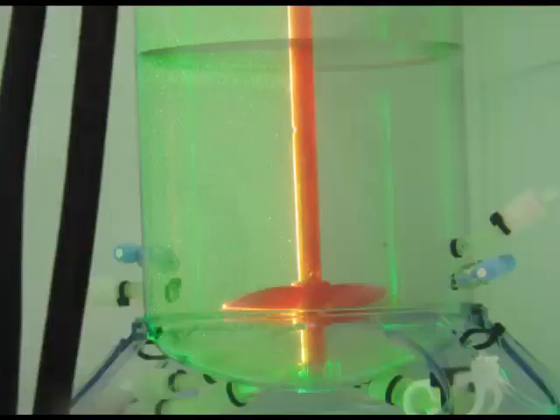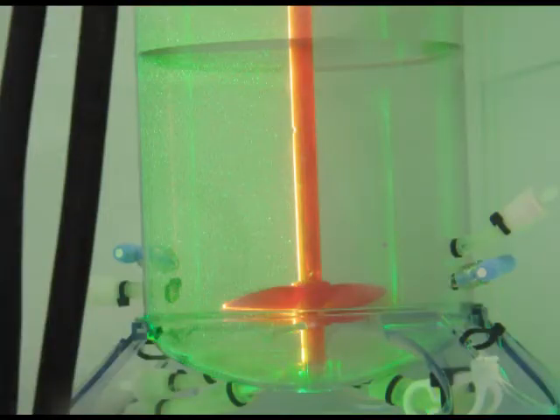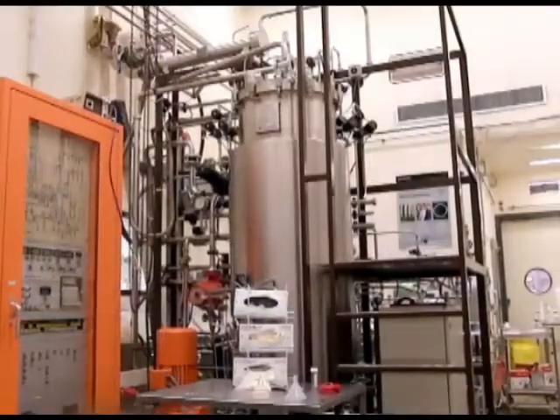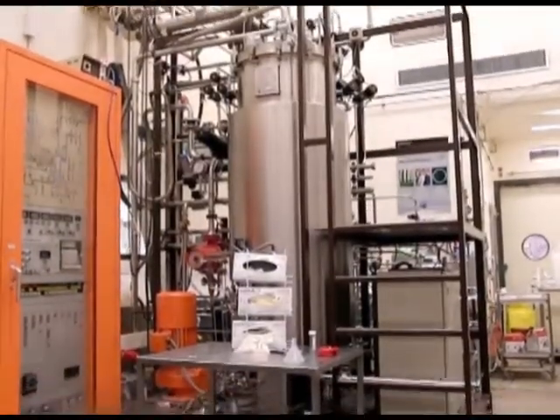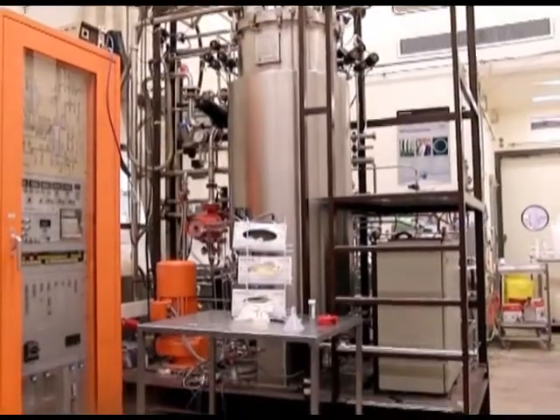This insight into particle velocity and fluid flow rates can lead to better design of bioreactors, which will prove useful in a variety of industries such as the pharmaceutical industry.